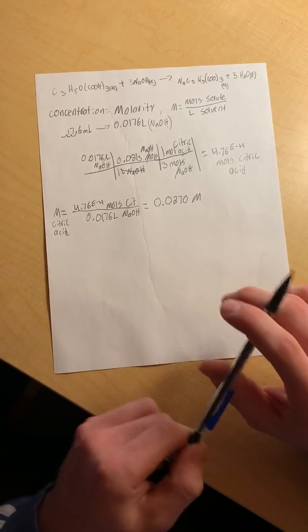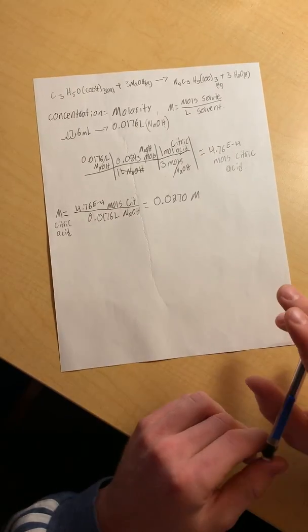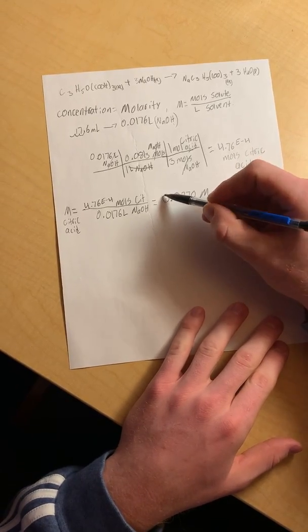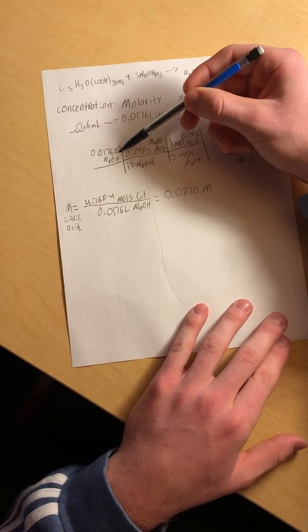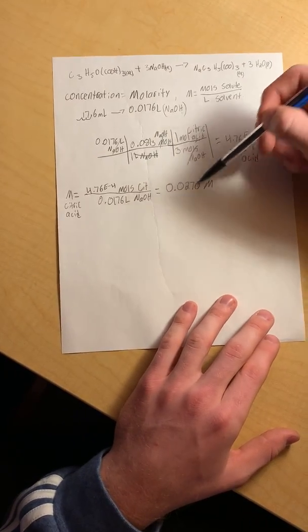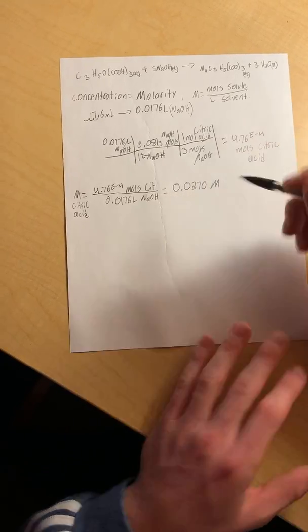The average of the three trials was this same number, because the liters we started with was the same for all three trials — we were very precise. Our average was 0.0270 molar for our first, second, and third trials.